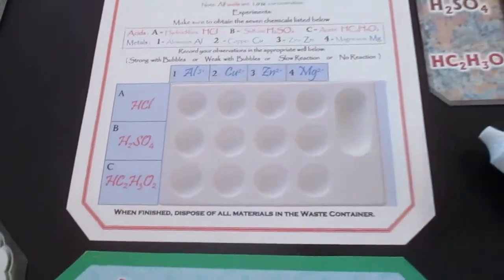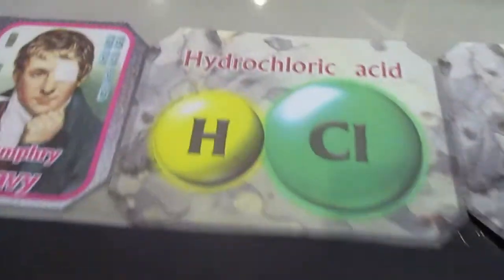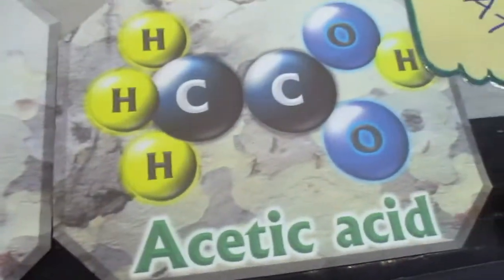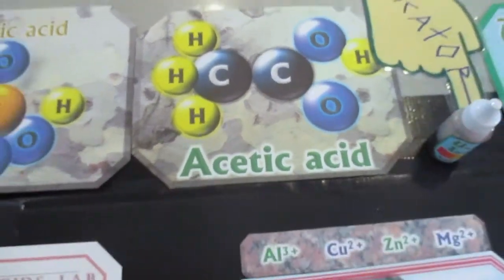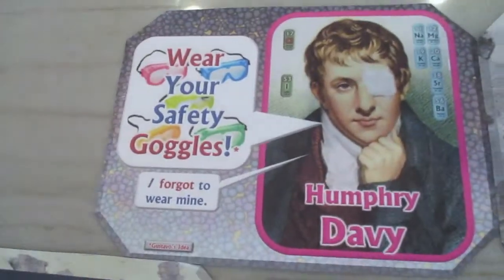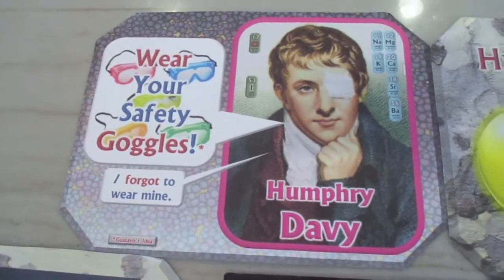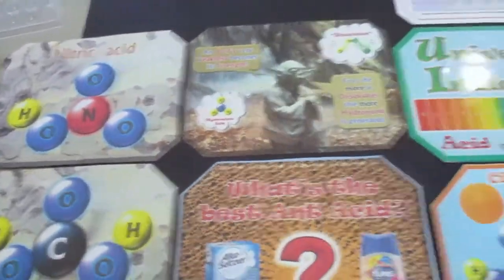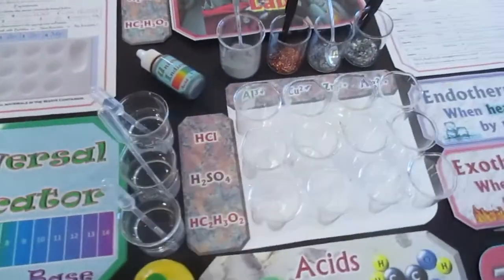Okay? So the acids we're using are hydrochloric, sulfuric, and acetic. Now, all of these can actually be harmful, so we've got to wear safety goggles. Humphrey Davy forgot this once. This is one reason that we always wear our safety goggles. Great chemist, by the way. And the acids that we are not using in this lab, or wait, maybe we will.